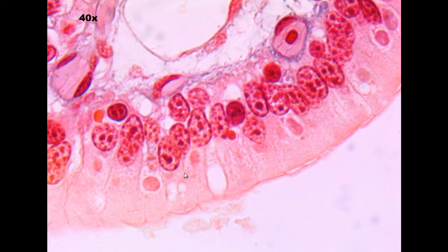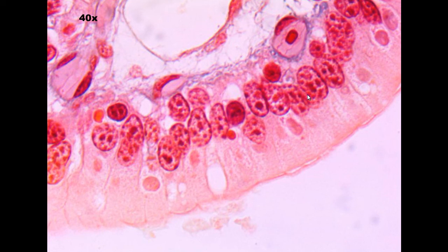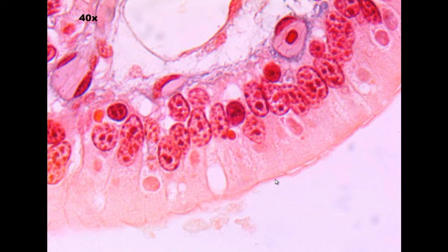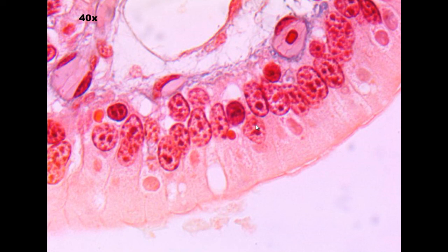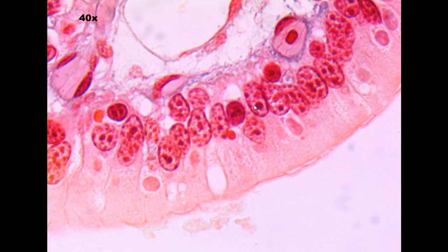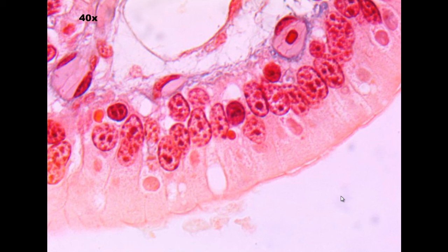And this last one: do we see a band of nuclei? Yeah. Does it have cilia? No — it looks like it might have some microvilli, so it could be PCCE, but let's keep going. Is it a single sheet of cells? No. Does it have little buckets of cells? No. Are they square shaped? No. Are they rectangular? Are the nuclei in bands, and are there a lot of goblet cells? There's a band of nuclei. There's goblet cells. This one is simple columnar.